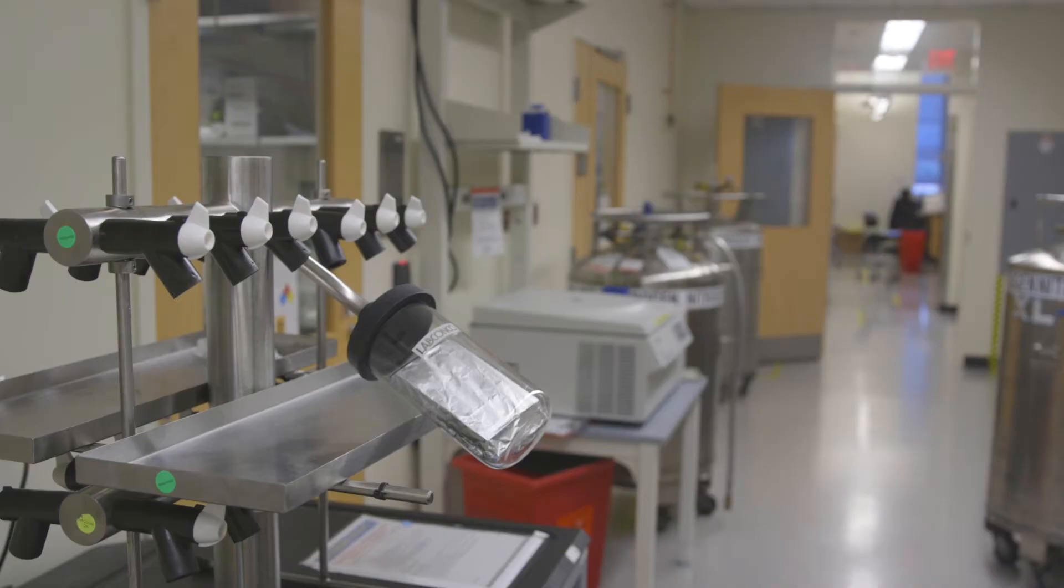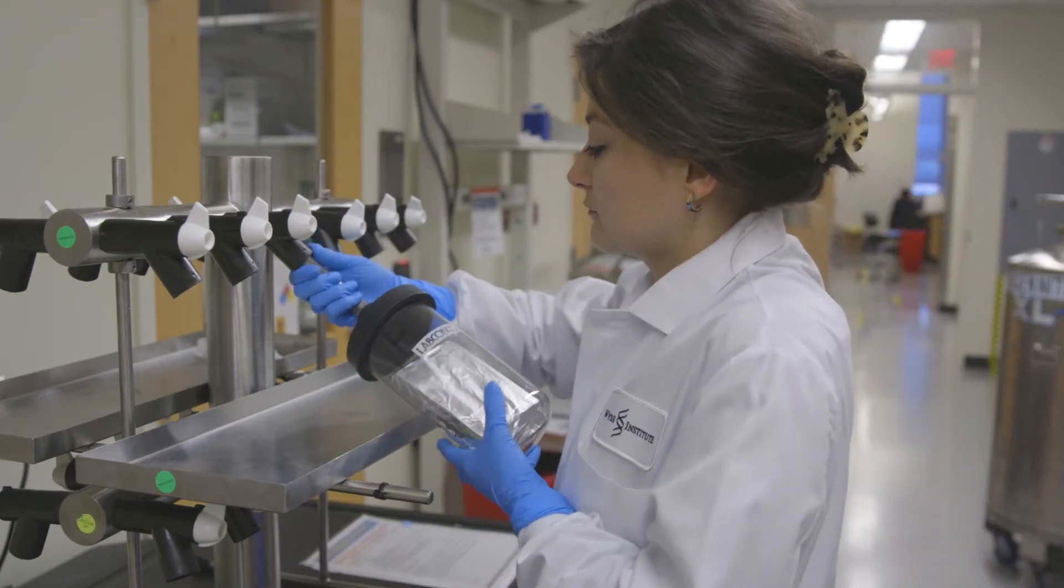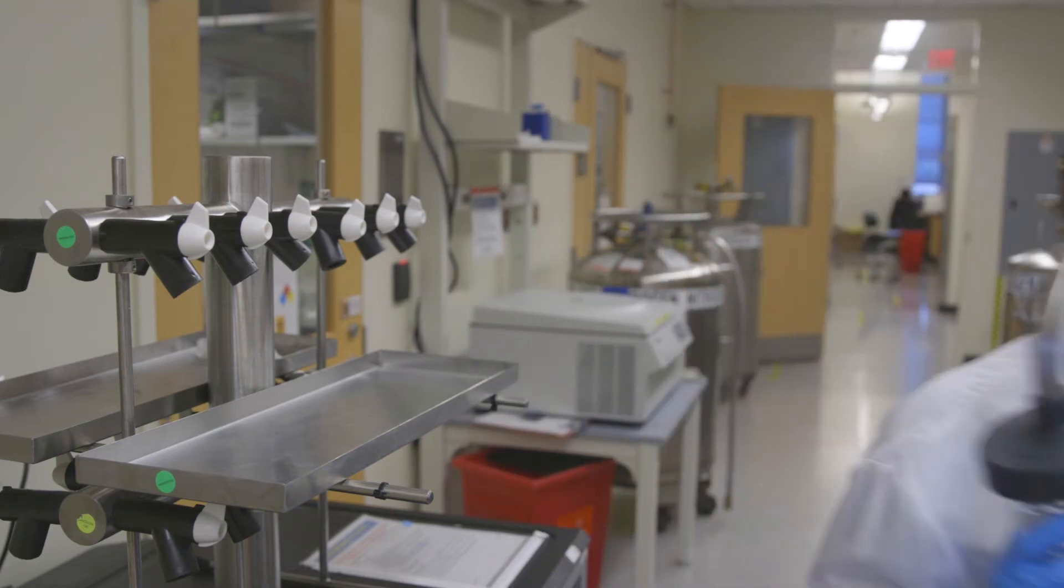The next day, the plate is recovered from the lyophilizer. The toehold reactions are now stable at room temperature and are ready to be used as diagnostic sensors.